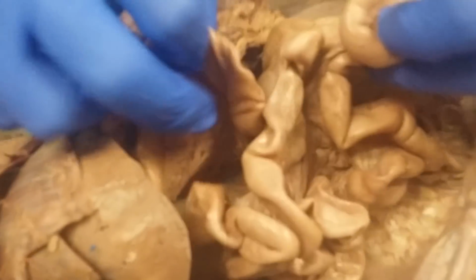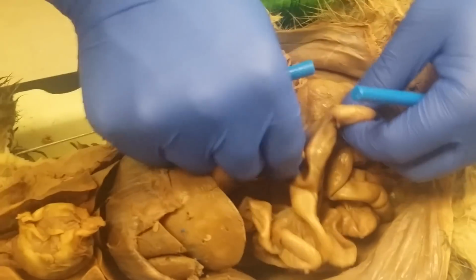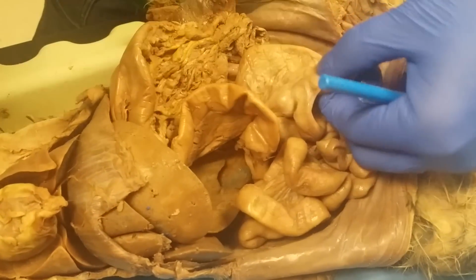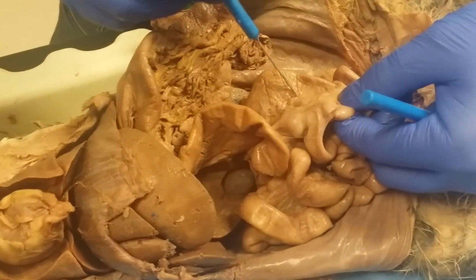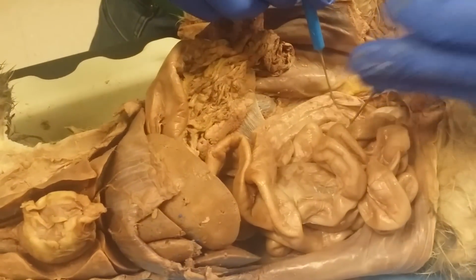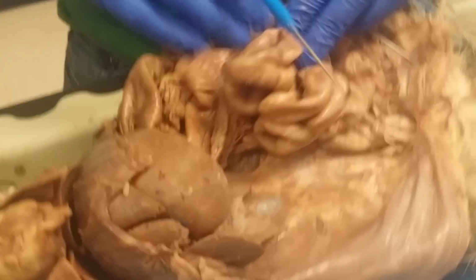Then, you know, you got the duodenum, which turns into the jejunum. Jejunum I don't really think will be on there because it's kind of hard to differentiate. But if you kind of like follow it around, basically there's the colon. So find this portion. This is where the ileum becomes the cecum, and the ascending colon comes up over here. It's across the transverse mesocolon, and then the descending colon, which turns into the rectum and goes out the poop chute. And butt scratcher.